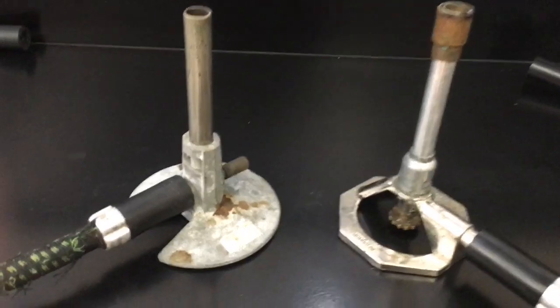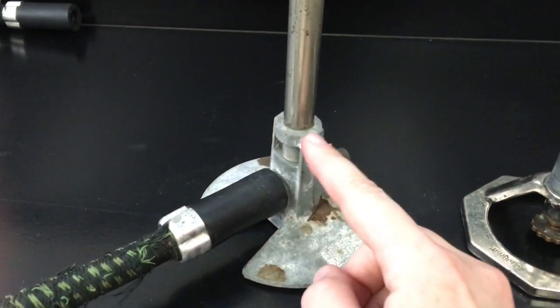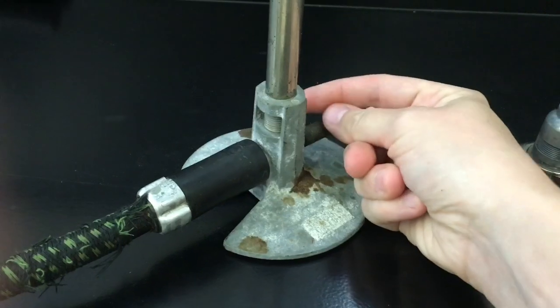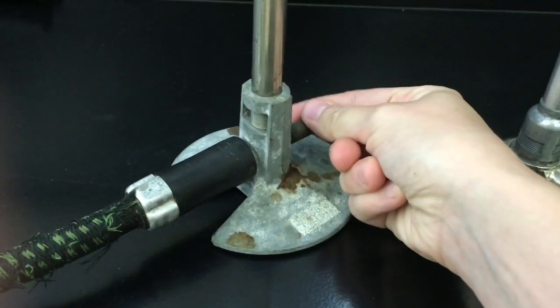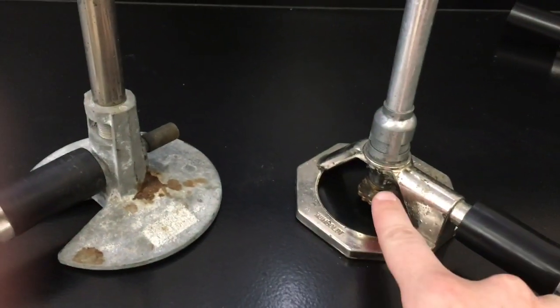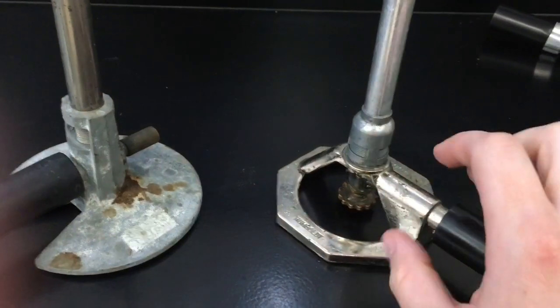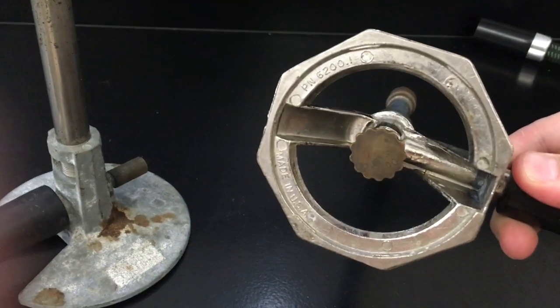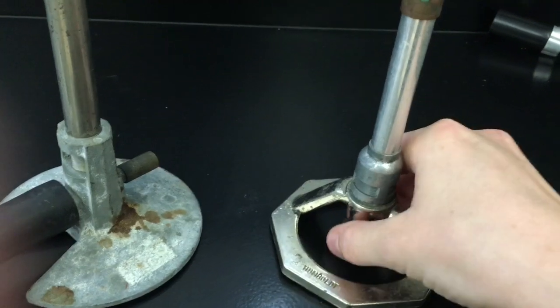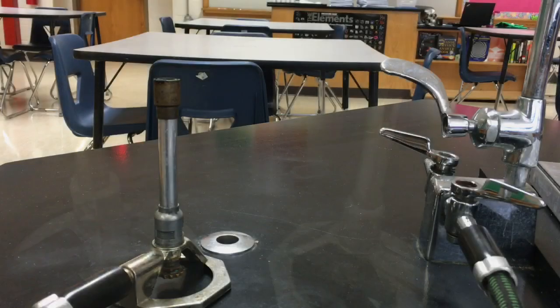The difference comes in where the valve is, which is how you adjust the flame. On one style of Bunsen burner, the valve is located on the side — it's a little knob that you twist back and forth. On the other style, the valve that adjusts the height of the flame and gas flow is located underneath. It looks like a little flower; you twist it from one side to another to adjust the height of the flame.